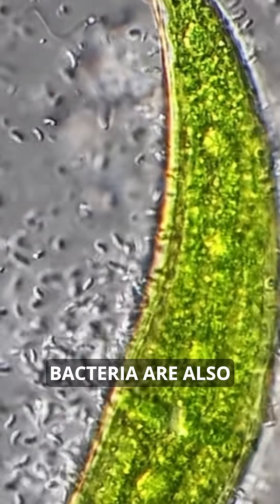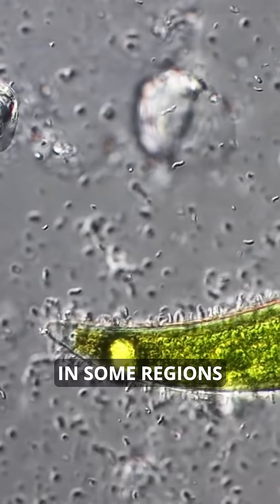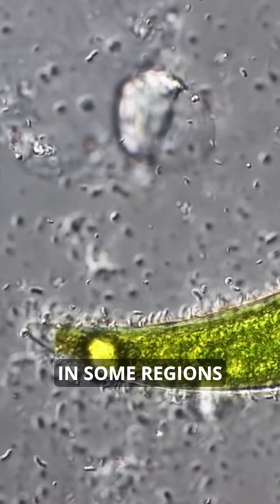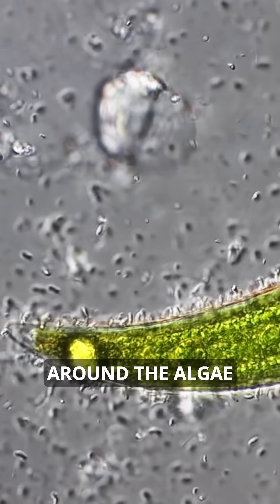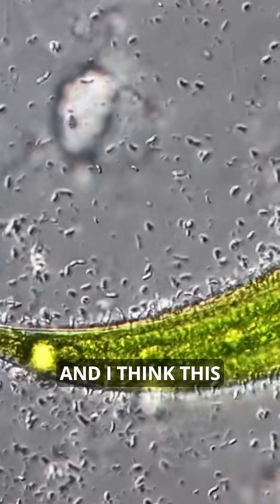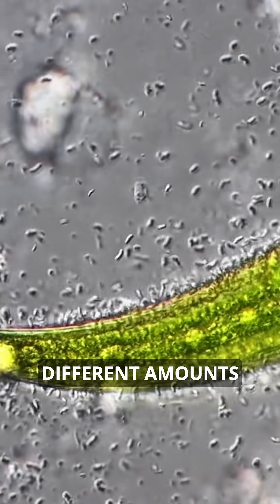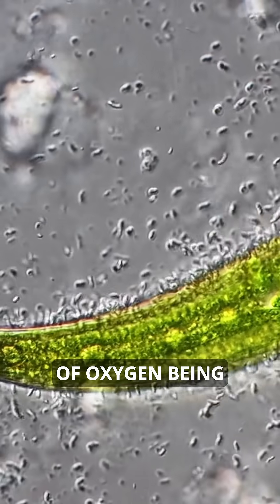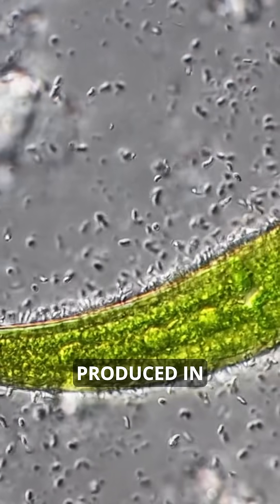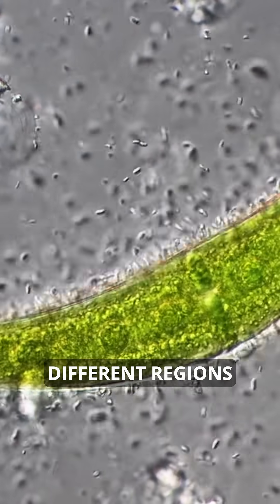You can also see that the bacteria are more concentrated in some regions around the algae than in others, and I think this might have to do with different amounts of oxygen being produced in different regions here.